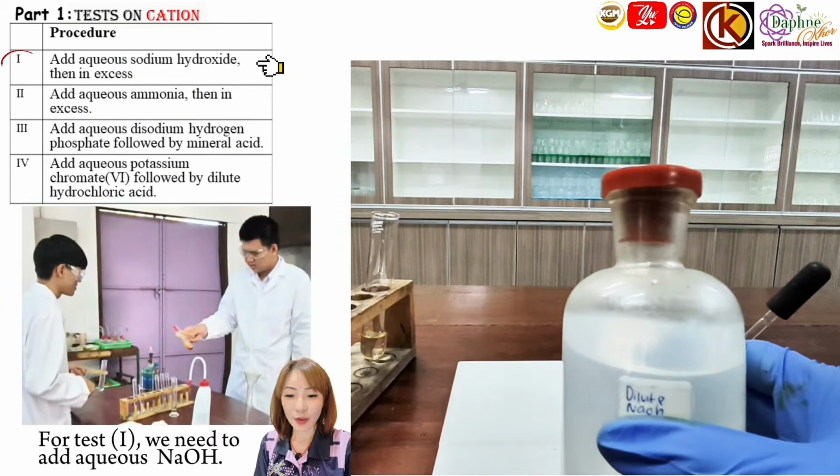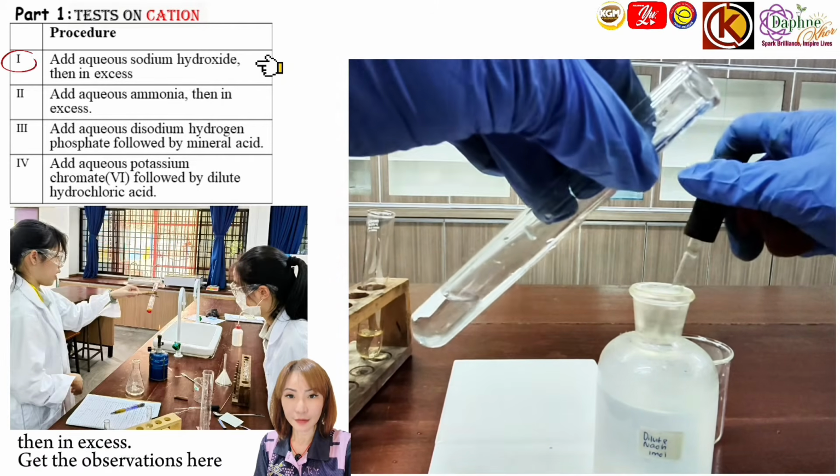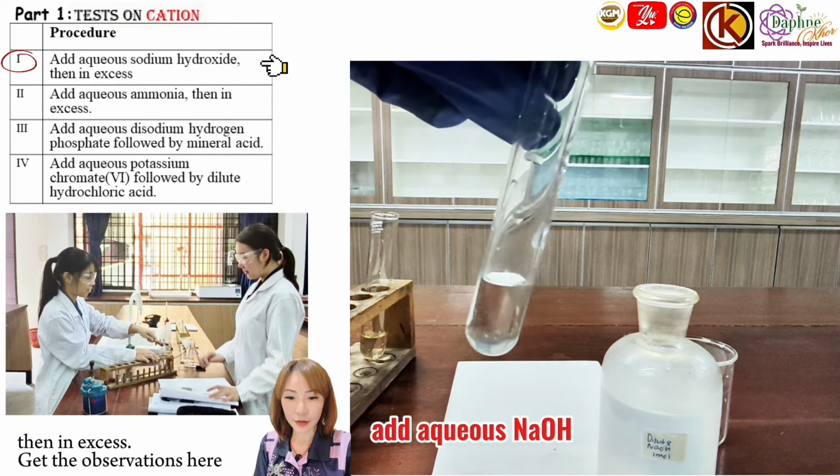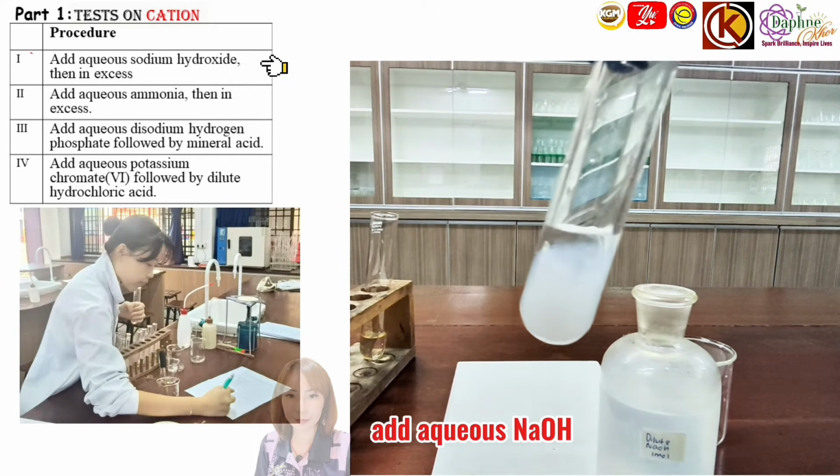For test 1, we need to add aqueous sodium hydroxide, then in excess. Get the observations here. Are there any color changes? Any precipitate?